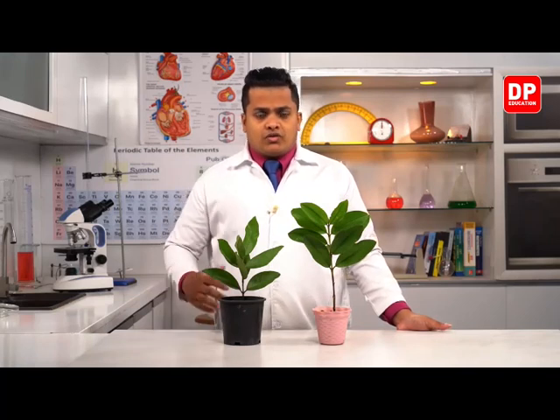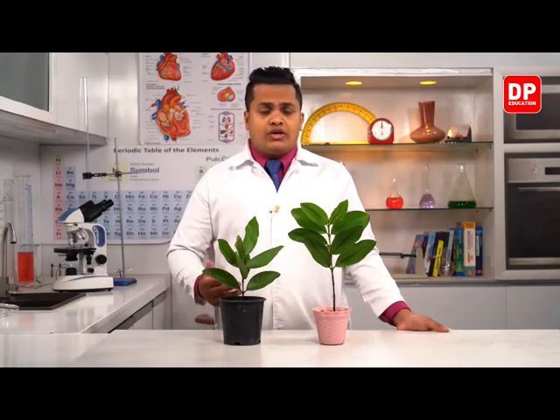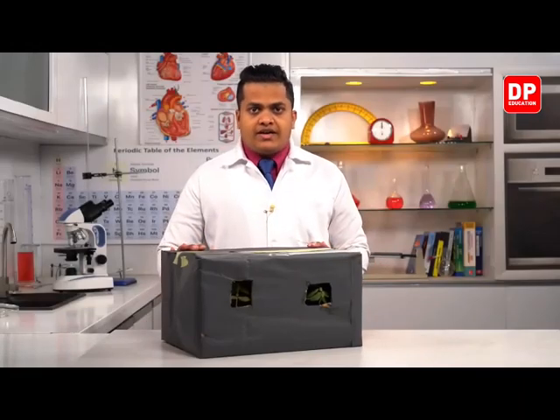So my dear children, it's very clear to us that for the growth of the plant, the apex is going to have a certain kind of impact. The apex is the one which is actually growing. Okay, so this is our clear observation from the setup. So it's very obvious to us that the plant apex is always the one which is going to grow. So let's head on to the classroom once again and we'll discuss what are the other things contained within the lesson.